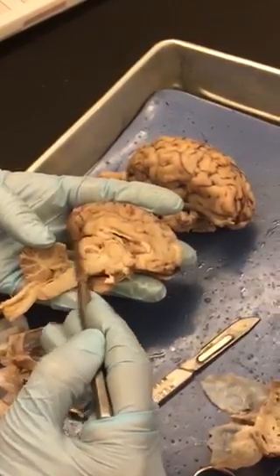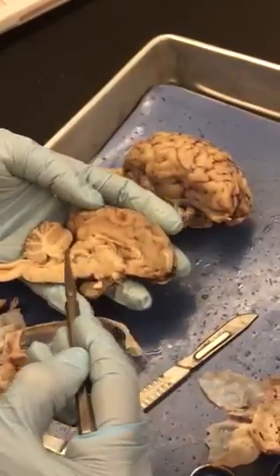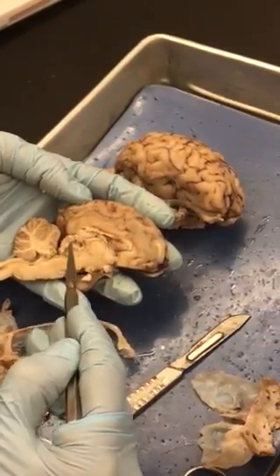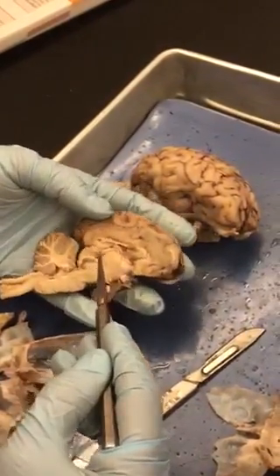Okay, going to the side here, you can also see the superior colliculus and the inferior colliculus, which is inside of that transverse fissure. This is part of the corpora quadrigemina. Just above that, you see a little circle. It's kind of at the end of the corpus callosum right here. That's your epithalamus, otherwise known as your pineal gland.